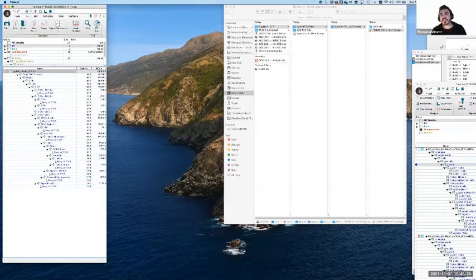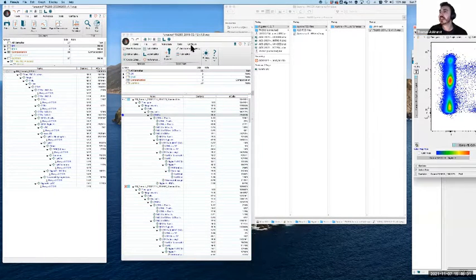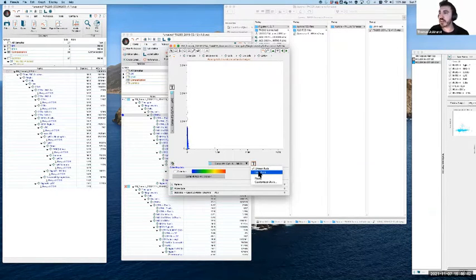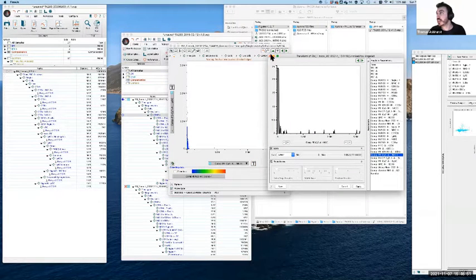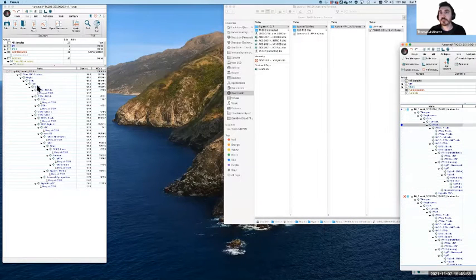Huh, that's interesting. Yeah. So everything we've been looking at has been in a bi-exponential plot. There is obviously the option to change these into either a linear axis, which we can then adjust the settings so that everything's visible, or even in some cases a logarithmic axis. So let me just quickly adjust this. Oh, that's for the Aurora data, sorry. So the value is going to be a bit weird. Let's go back to this one.